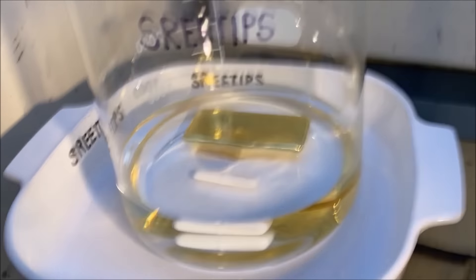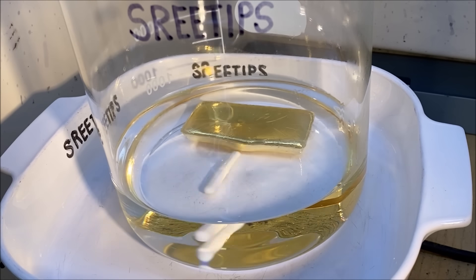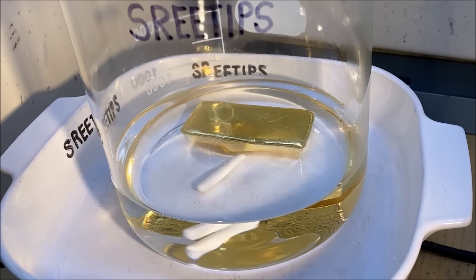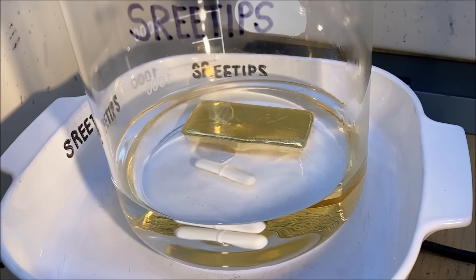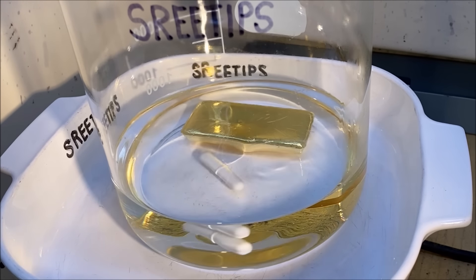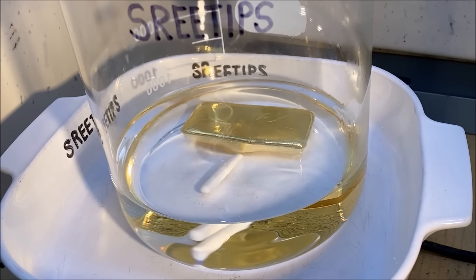Throughout the dissolve sequence I'll be adding shots of hydrochloric acid to keep it hydrated. When you're watching the time lapse and it jumps, that's me adding hydrochloric acid to rehydrate the reaction. Now I'm going to put this on time lapse and start the nitric acid flow to form the aqua regia and dissolve our 51.5 troy ounce pure gold bar.